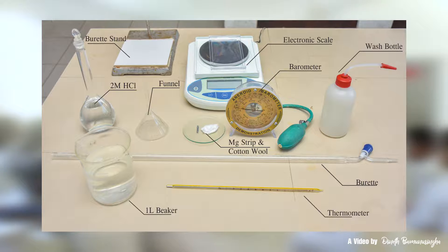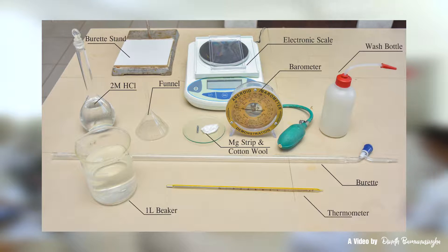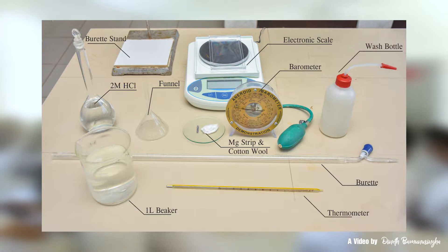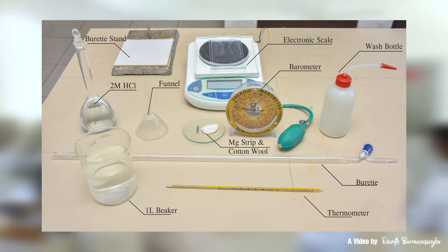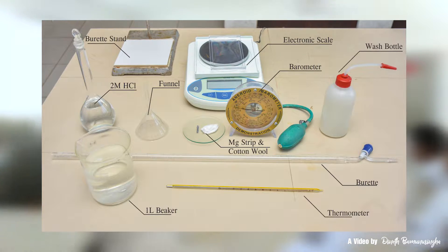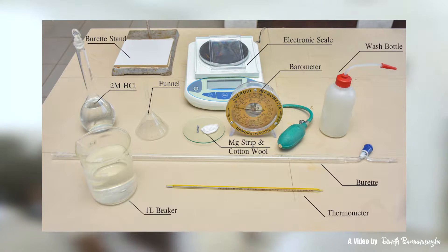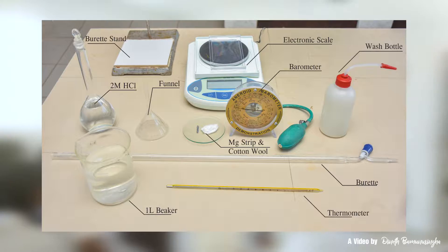Materials needed: a burette, a 1-litre beaker, a burette stand, a thermometer, a barometer, a magnesium strip, 2 mol/dm³ hydrochloric acid, cotton wool, a wash bottle, an electronic scale, and a funnel.